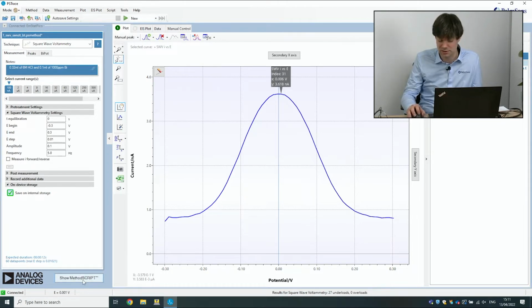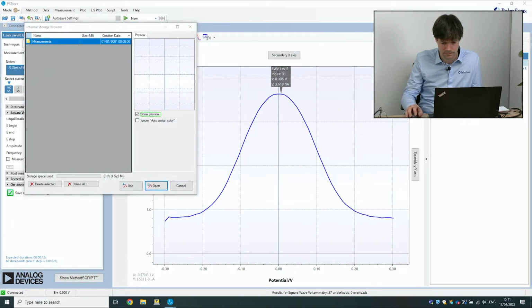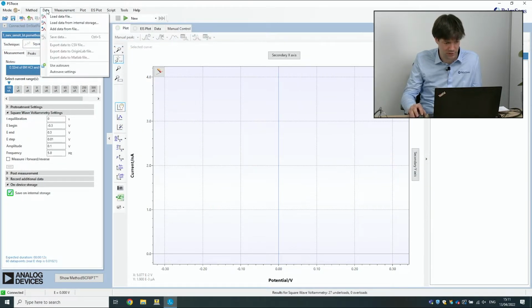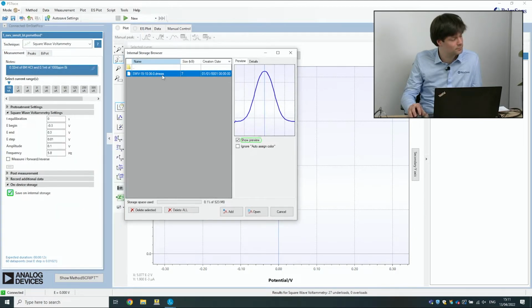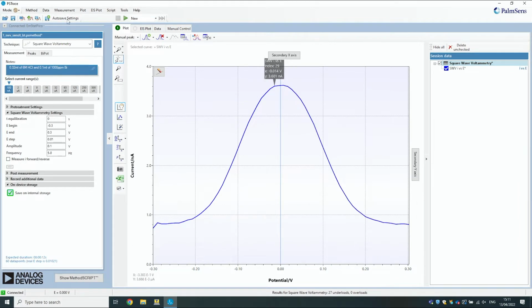Now we want to add some extra things. First I'm going to show that we do indeed, let me delete this measurement just so we know we're actually loading something, and then we're going to load the measurement from the onboard storage. The difference to the normal load data command is just that this is now loading from the internal memory of the device, right? Yes. So I could have done this measurement in the field and without any PSTrace attached, and then I could load it later using this feature. Yeah. There we go. We can load it from the disk.